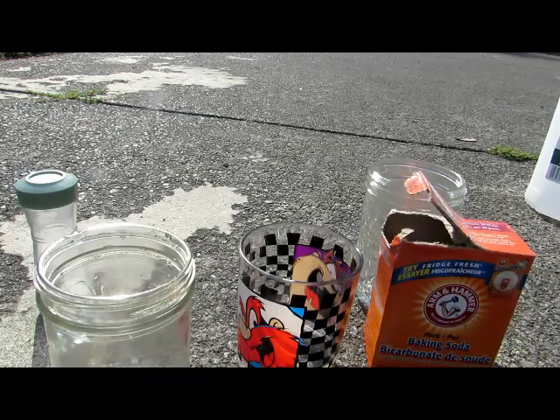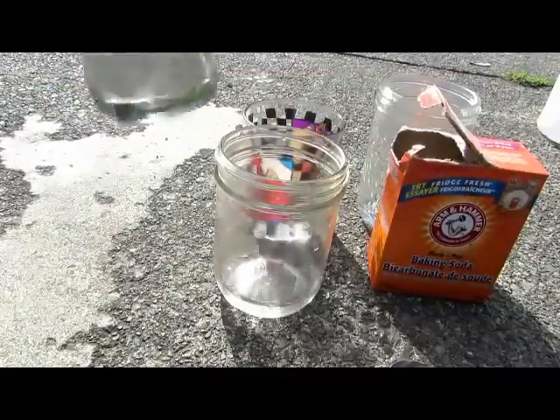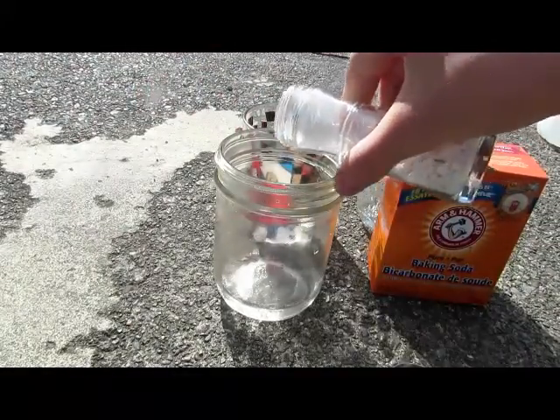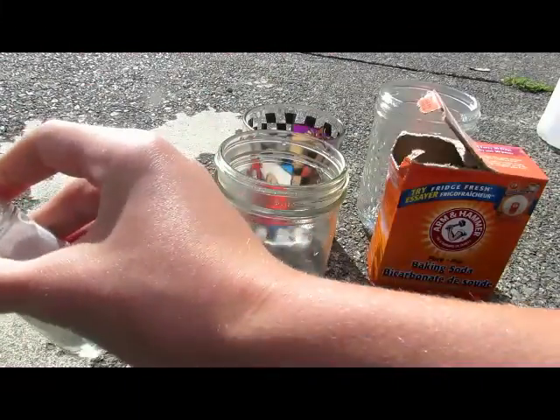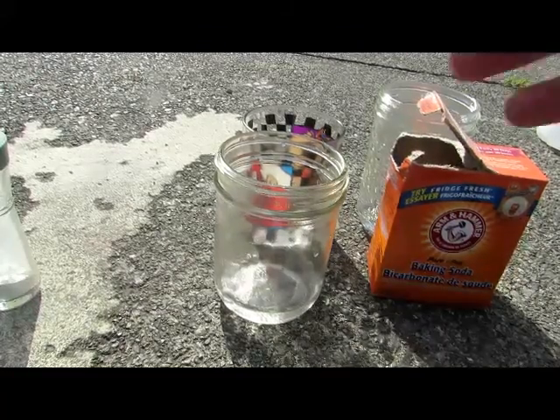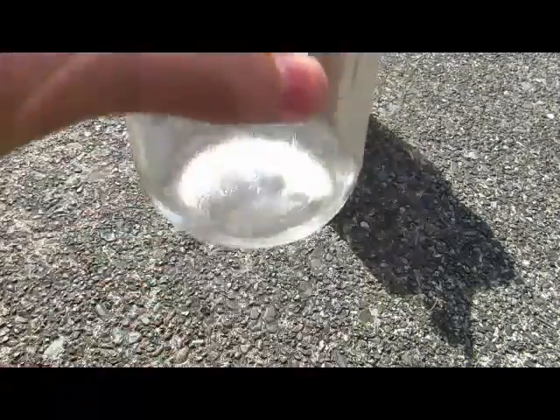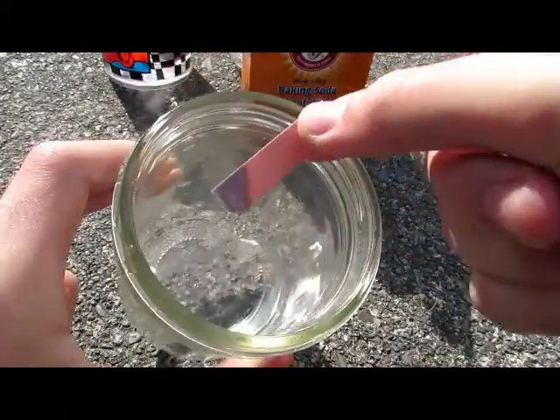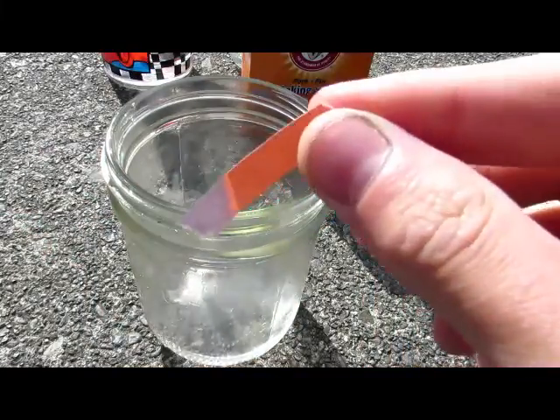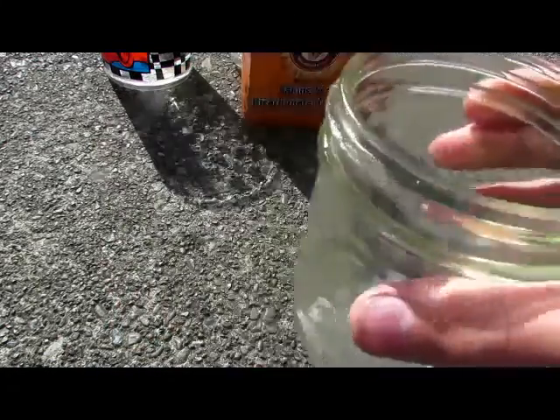Adding a bit of our product to water, I can see some small bubbles forming as it slowly reacts. After swirling for about a minute, everything appears to have dissolved. Testing with litmus paper, it turned blue, indicating it's very basic — so we clearly have lithium hydroxide in solution. There were also small bubbles of oxygen coming off. We can confirm it's behaving as lithium peroxide should.